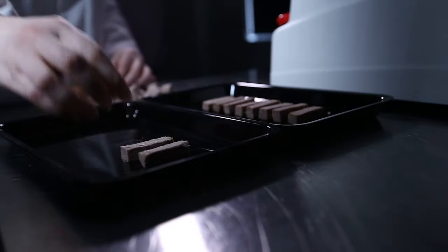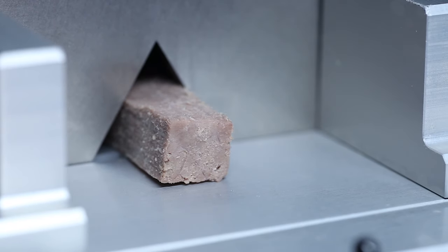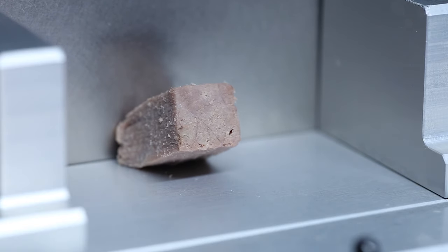Work through the rest of the cores to get an average for the sample. This will give an indication of meat-eating quality and could help to identify areas in production which could be altered to improve tenderness.